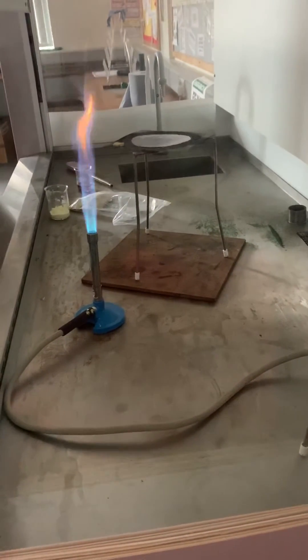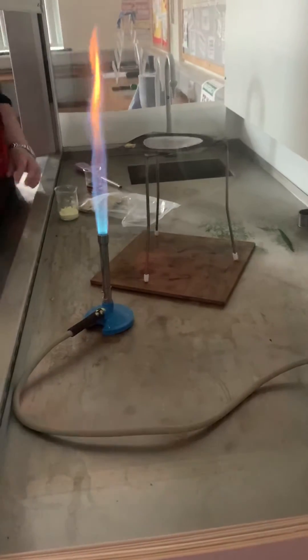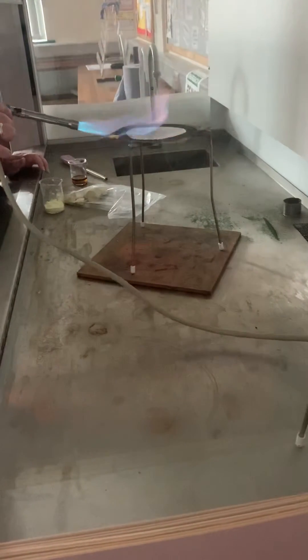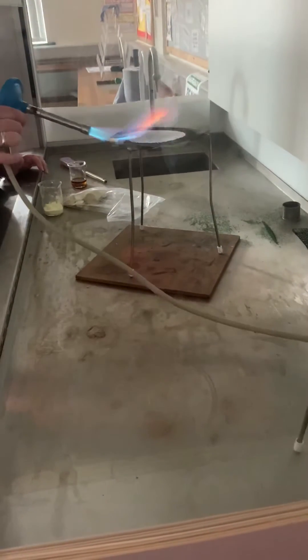But if not, hopefully it'll burn on the gauze and you'll just see the flame coming out of the gauze. Let's have a look - I might need to try this a couple of times. So, getting it to start burning. You'll see it'll melt first.